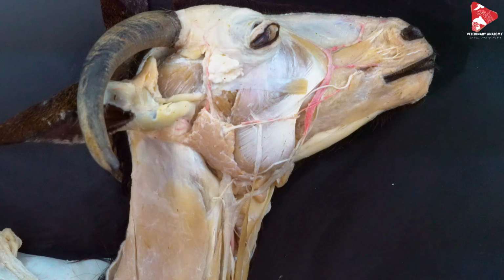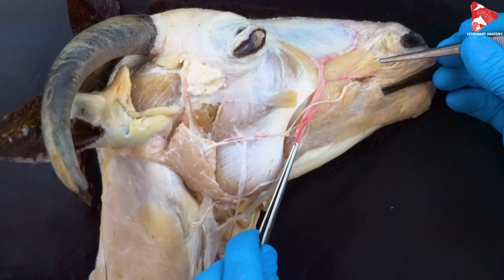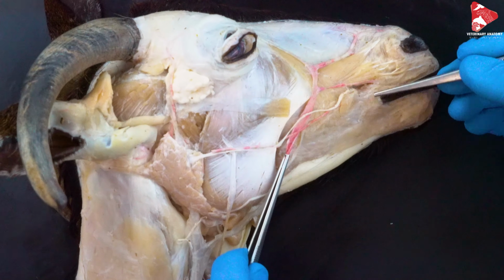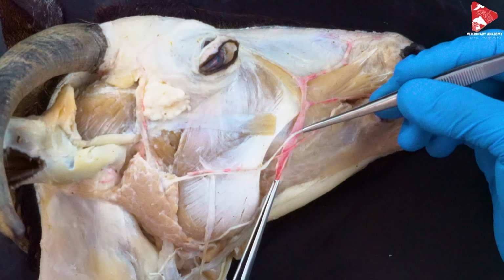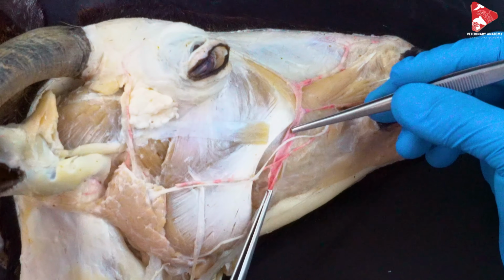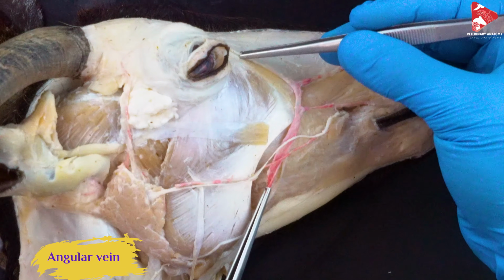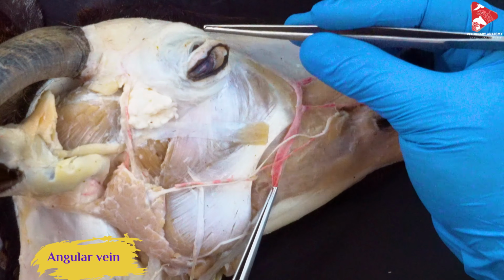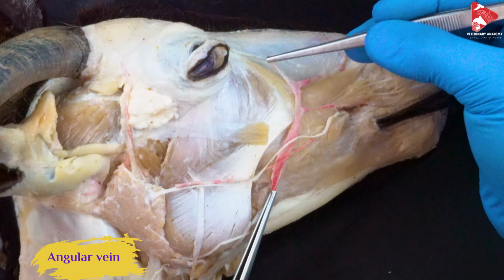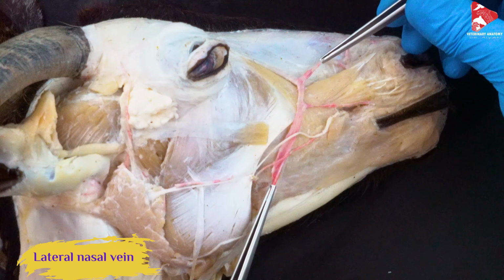Sternomandibular muscle. Here, regarding the facial vein, you will see that the blood is collected from the different parts of the head, or the face, to form the facial vein. So here we have the angular branch, which comes from the angle. This one. Here we have the lateral nasal vein.